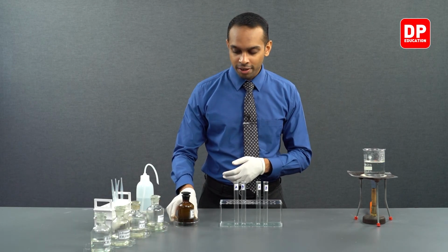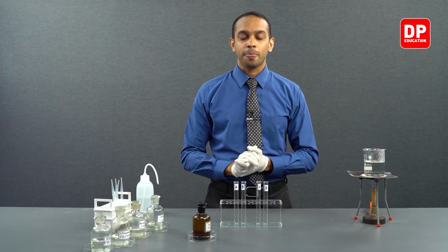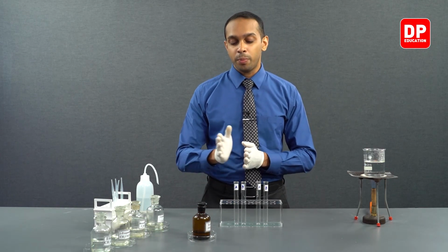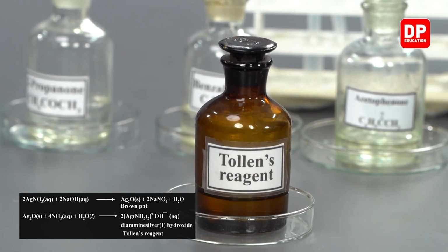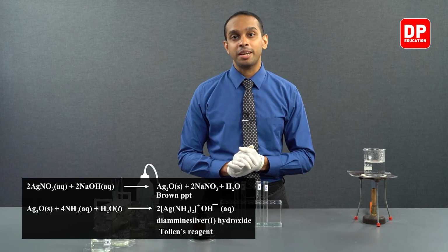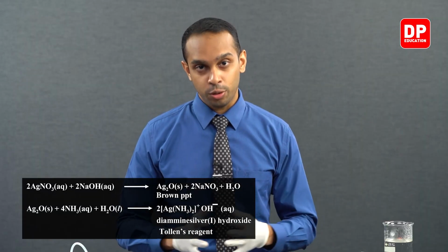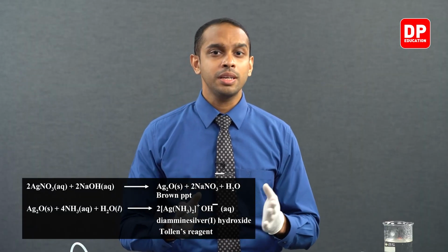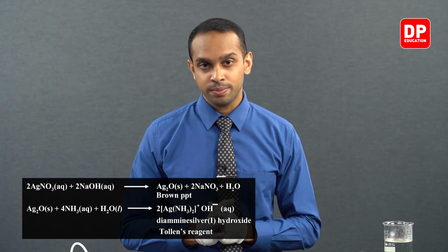So what we have here is our Tollens reagent. The way that we can prepare this is mentioned in our practical book as well. But just to go over the method, again I will mention it here. We will take silver nitrate solution, and to it we will add a few drops of sodium hydroxide.